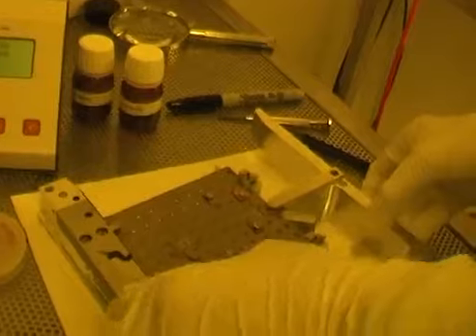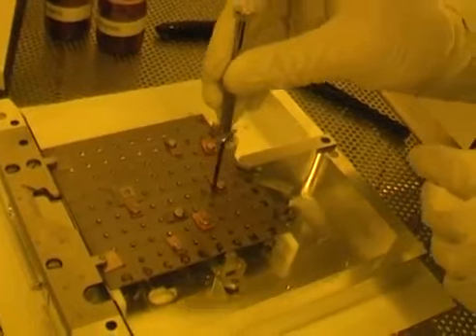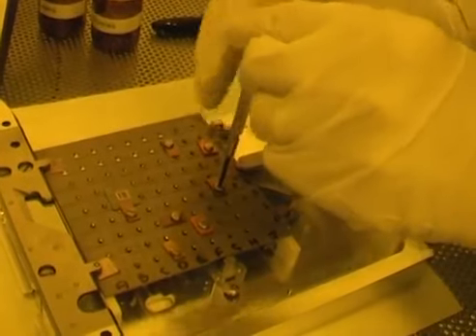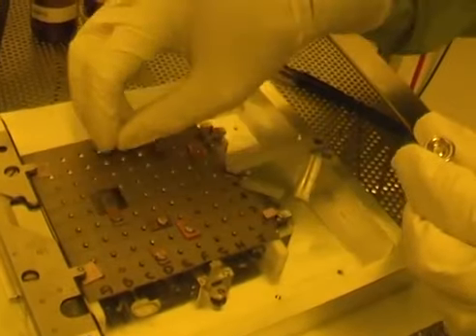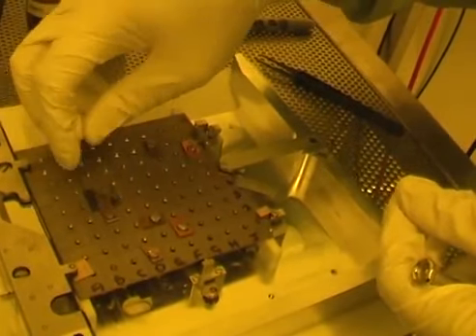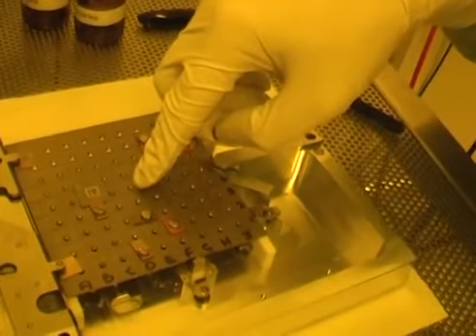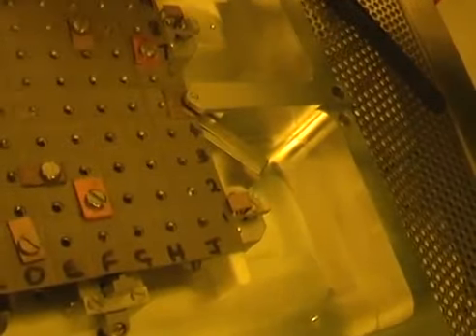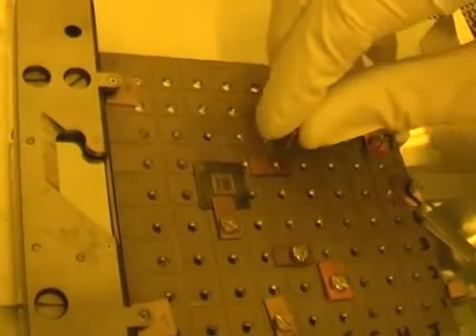One thing at a time, so we need to add an extra clamp to this sample. So let's choose a clamp. And the problem is that the clamps only go in certain locations. And on this particular holder, you can see the screws are not central, which means the clamp can only go in two directions. I can't easily put a clamp facing that way. I can make a clamp face that way and then move the sample a little bit towards it, and that should work.